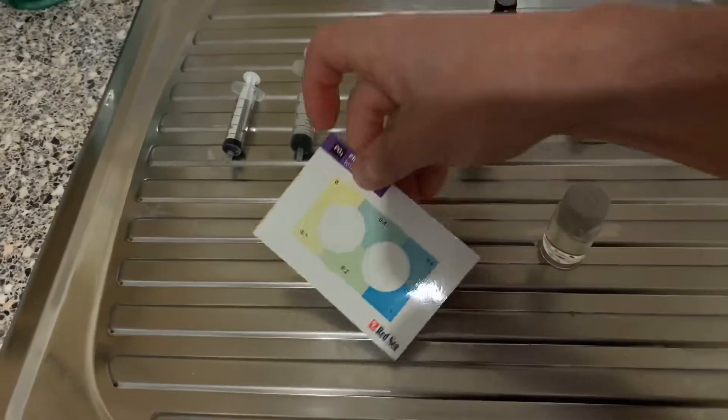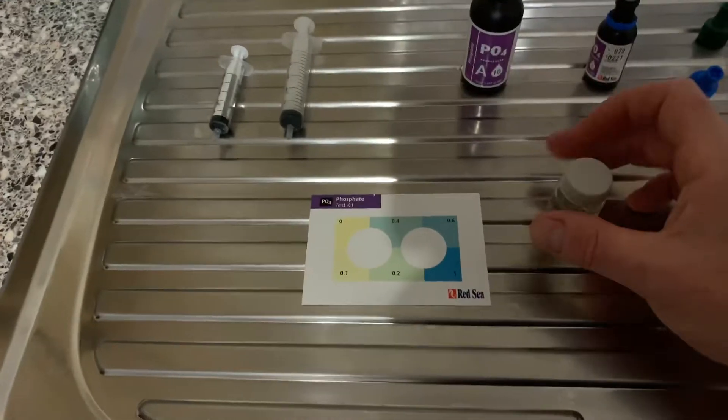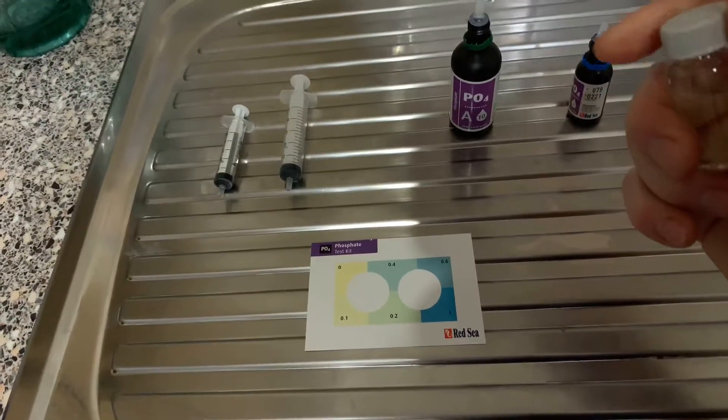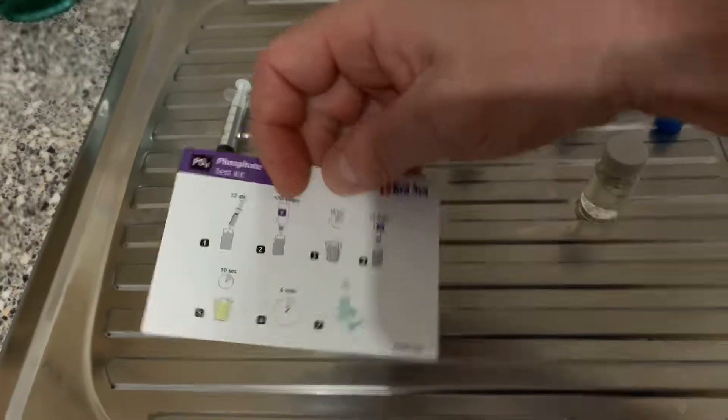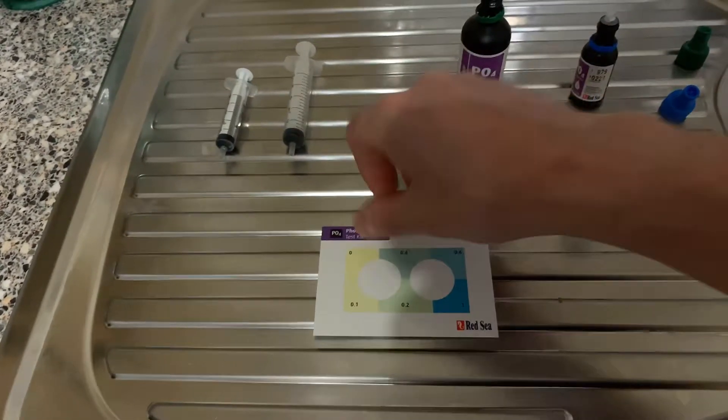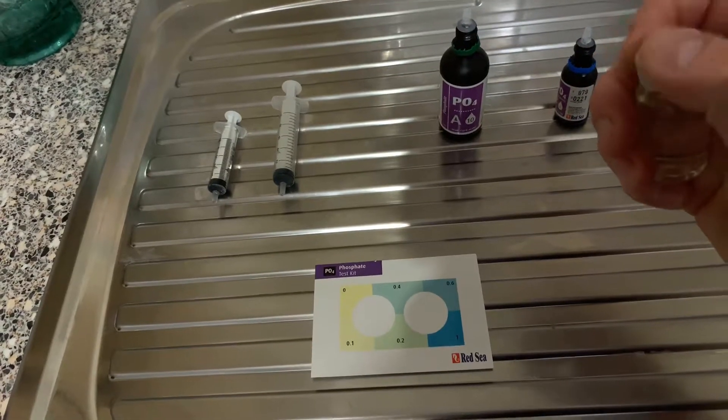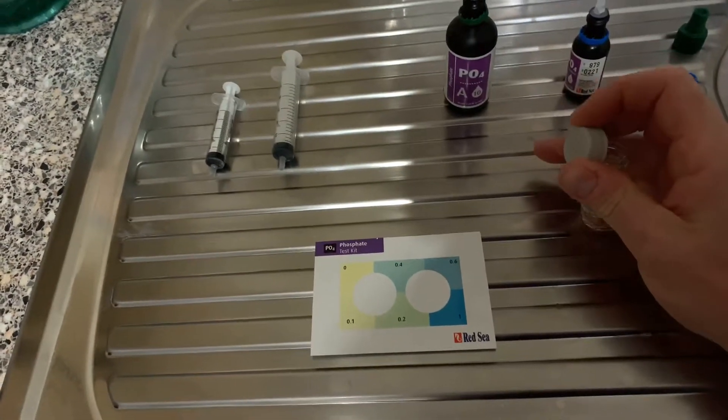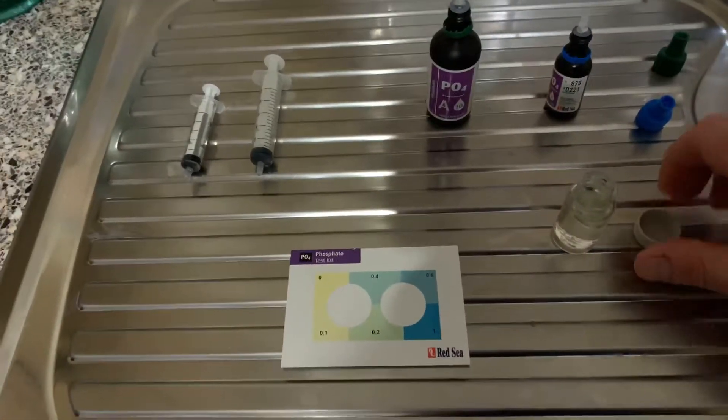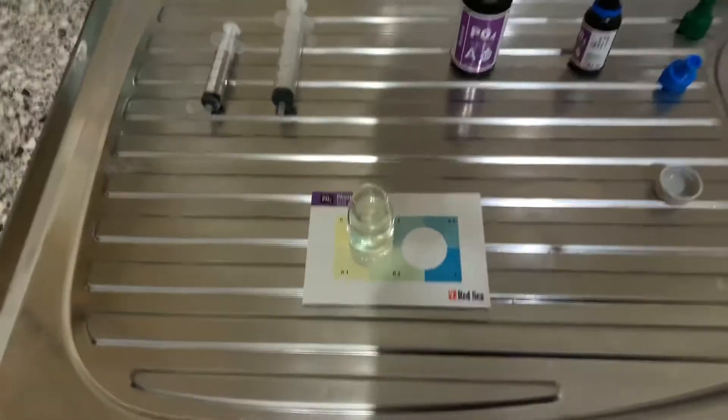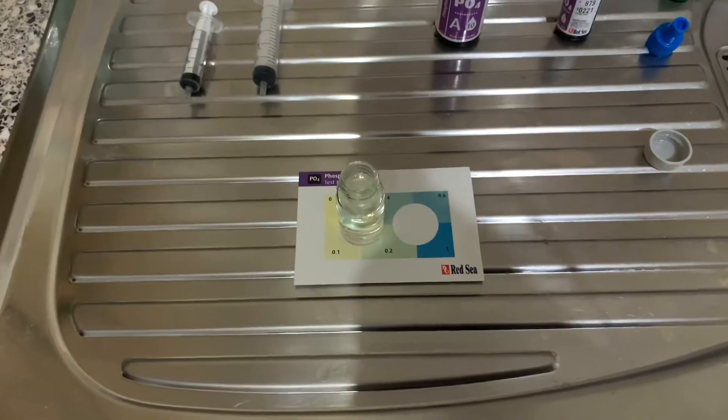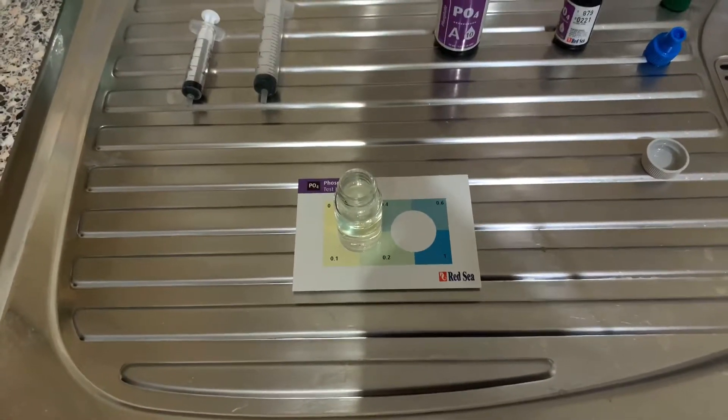And then we'll look on the back of the test card and then we'll compare. Yeah, so we have to wait 6 minutes. Let's put that on there. Last time I tested this, this was virtually zero. But we'll come back in 6 minutes.